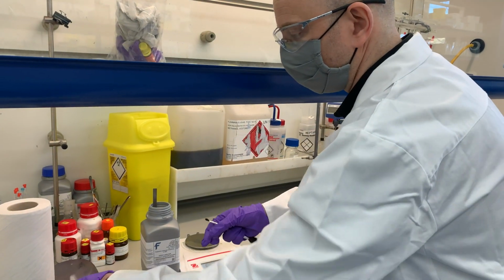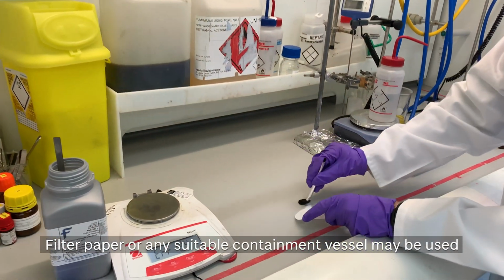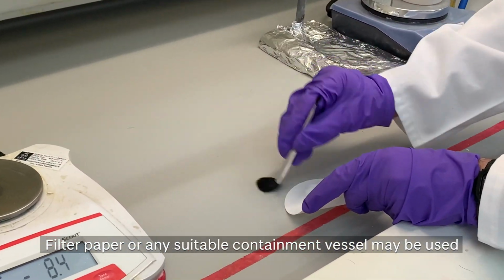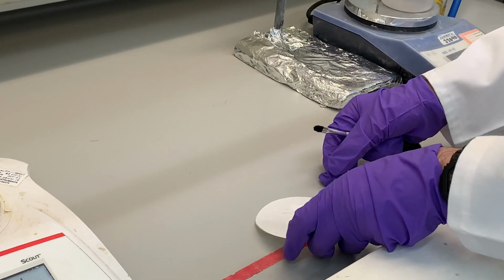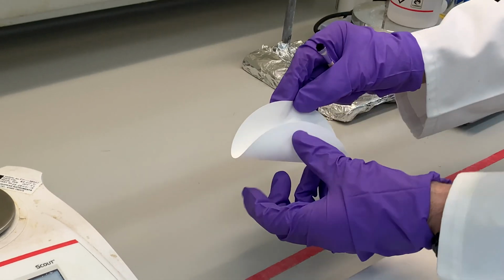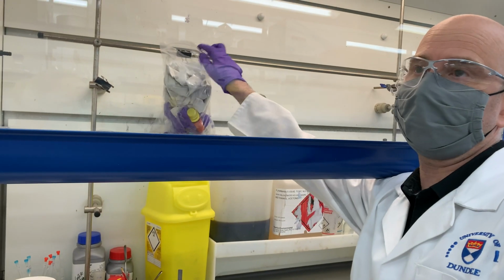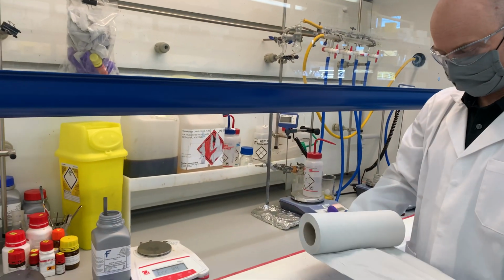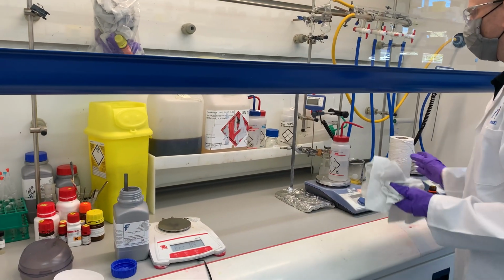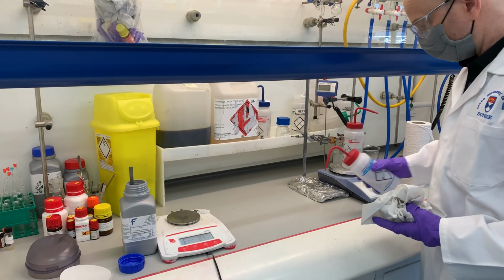Now that I've got most of the powder in place, I'm just going to use a filter paper or something else convenient to hand that I'm going to brush the powder on. So I've got all the powder contained. And then I can just fold that up and add that into my standard waste inside of my fume hood. And now I'm just going to wipe the area down with water.